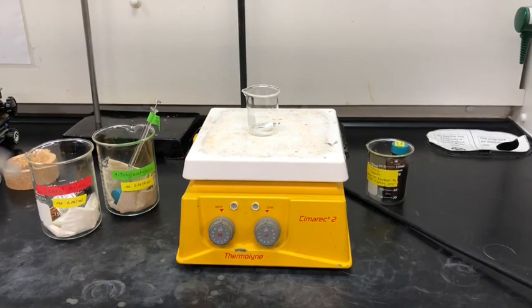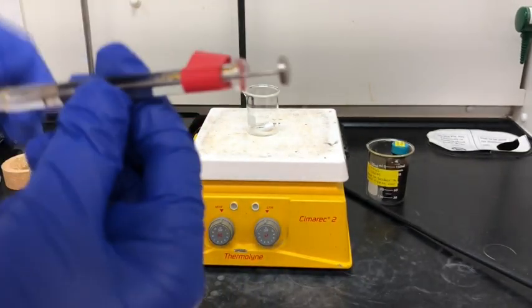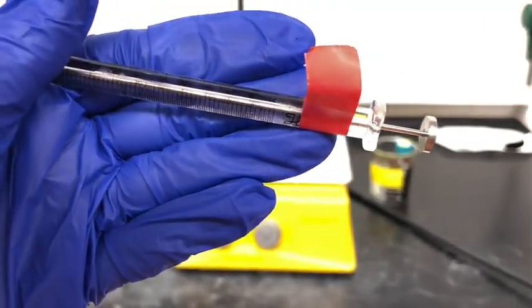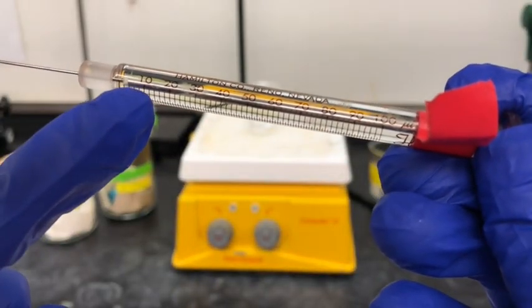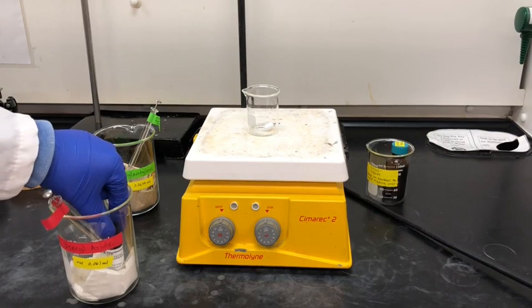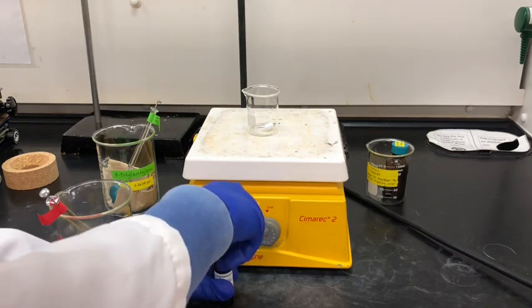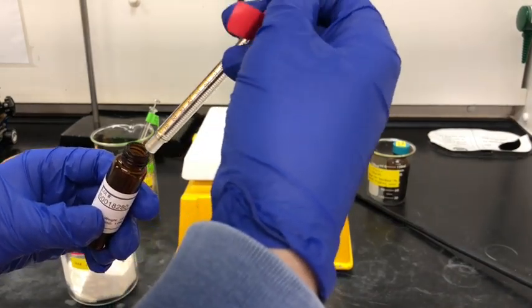Here I just wanted to zoom in a little bit on the syringe. The syringe has microliter readings instead of milliliter readings, so if we need to measure out 0.067 milliliters, that's actually going to be 67 microliters. So let's measure out the benzyl azide — we only need 0.067 milliliters, and if we convert that to microliters, which is the unit on our syringe, that means we need 67 microliters.